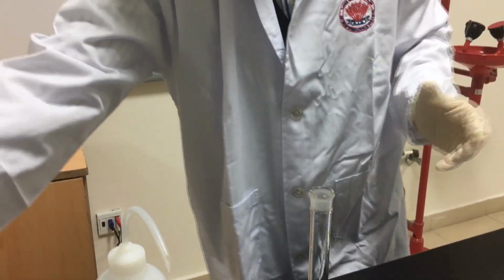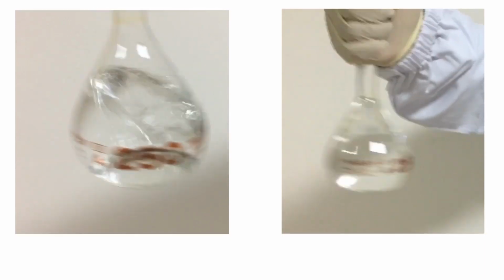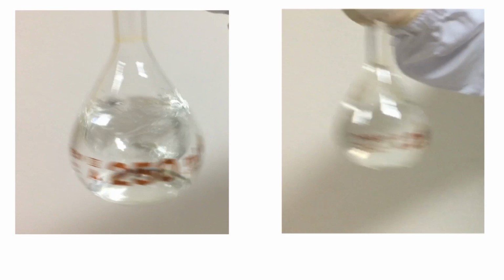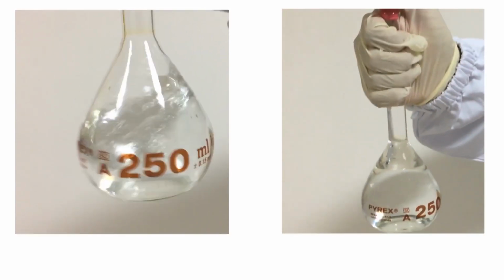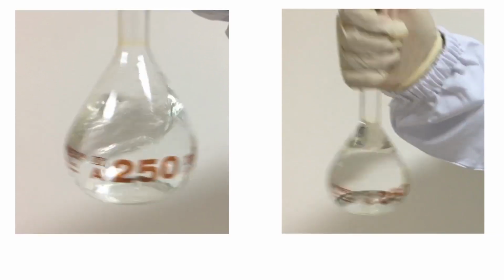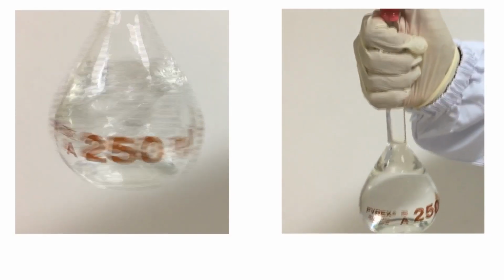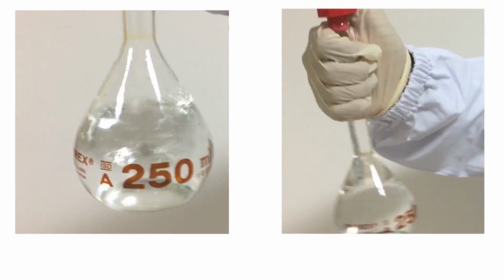Swirl the mixture very well to be sure that the whole quantity of sugar was dissolved. When the volumetric flask is half filled, there is enough space to mix the water and sugar, but if water reached the neck of the volumetric flask, there will be no available space for mixing. Accordingly, part of the sugar won't be dissolved and will settle down.